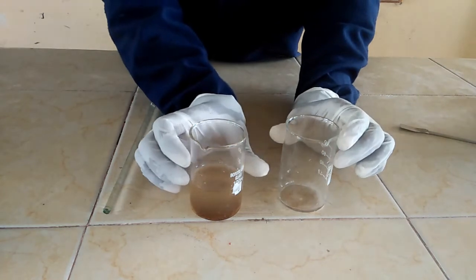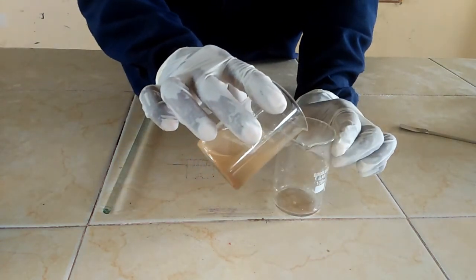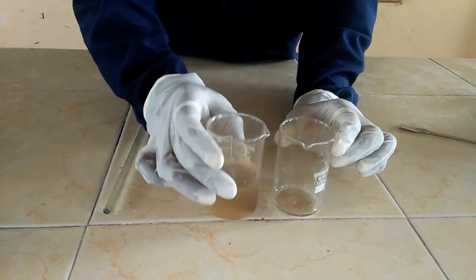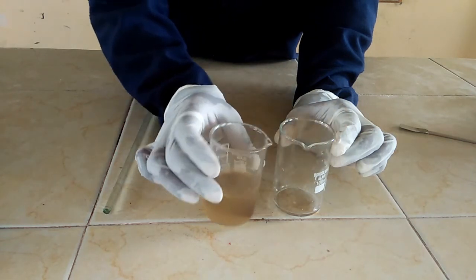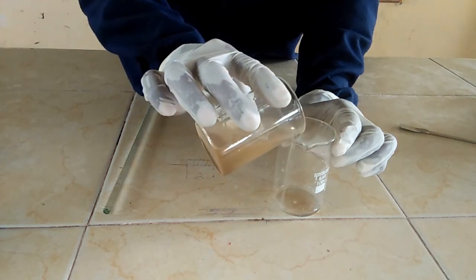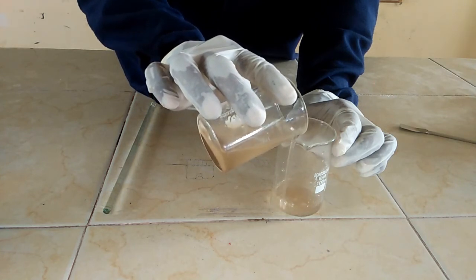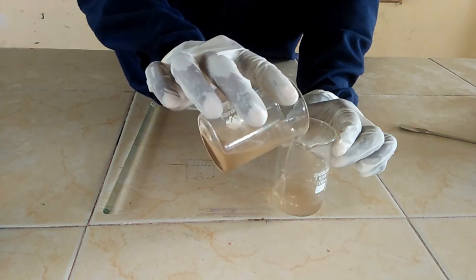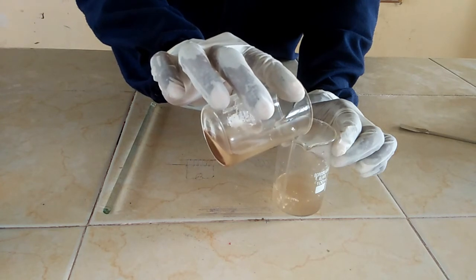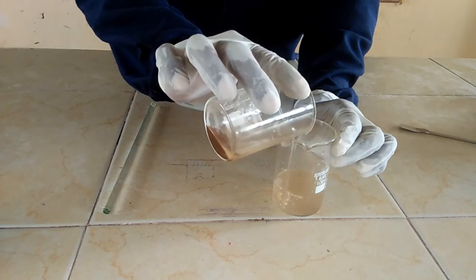Number two, you carefully transfer the liquid into another beaker. I am going to do this very carefully — I am going to pour the liquid into another beaker. We are pouring the liquid, which is water, into another beaker.